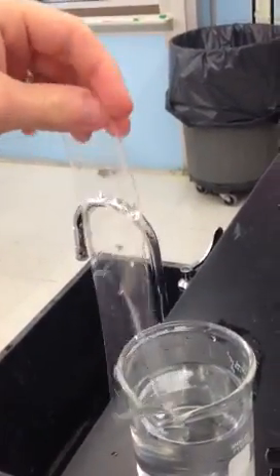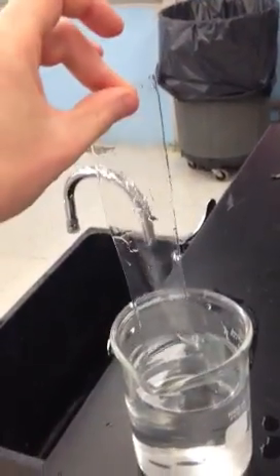Okay, so we have our beaker of warm water, and we have our dialysis tubing, which looks just like it's one sheet, but it's actually a tube, it's just difficult to separate.